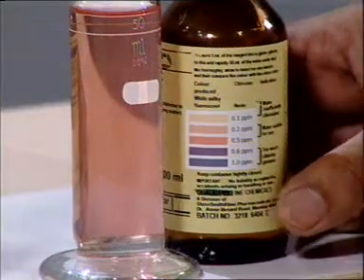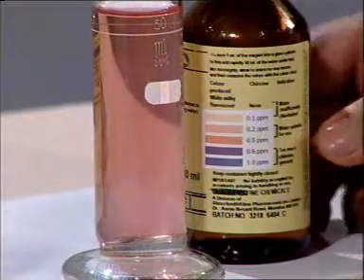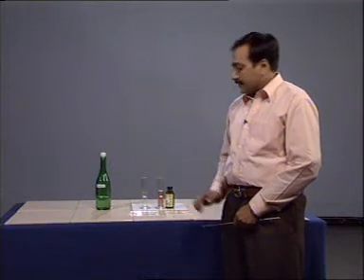Correspondingly, we can see that the water is suitable for use, that is, the chlorine is adequately available in the sample. Now, this method gives you very quick results, but simultaneously they give quite approximate values. However, for routine analysis they provide a good guideline. In order to make precise measurements, we must adopt the iodometric or spectrophotometric method.